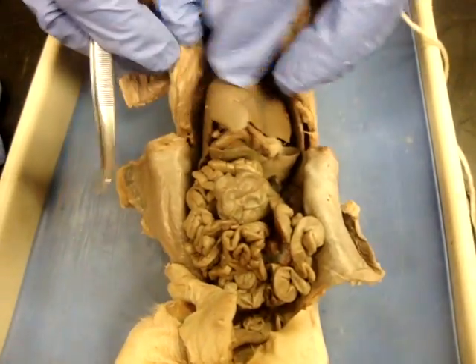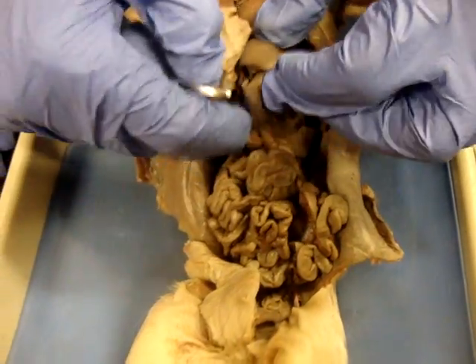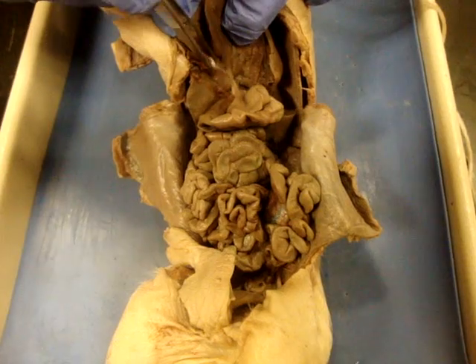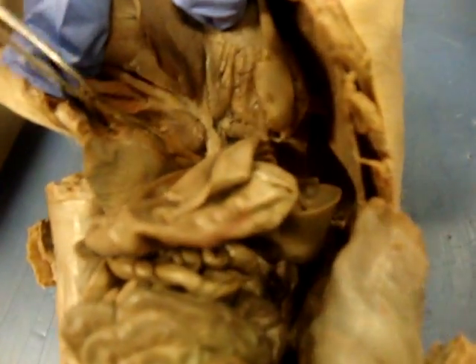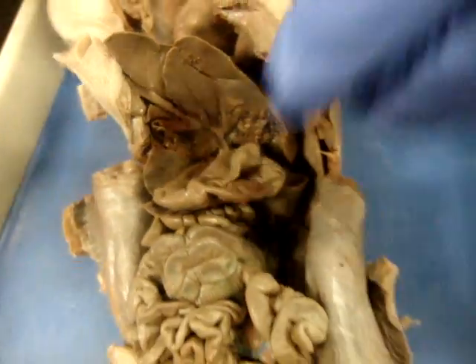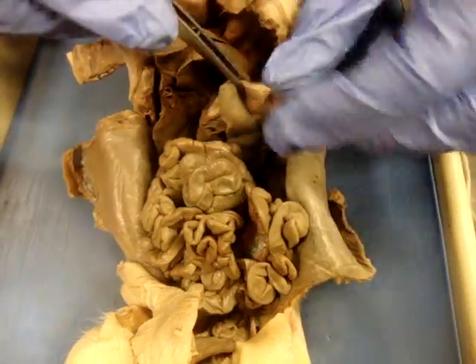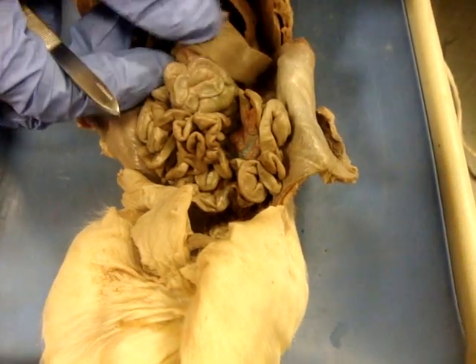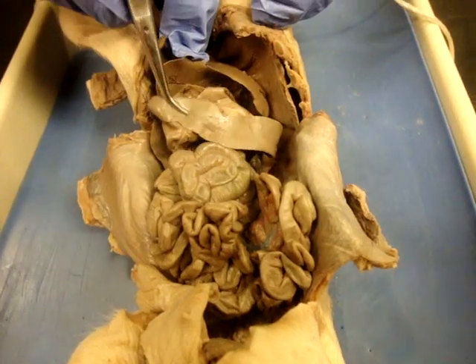Moving down the list, we then have the liver. The liver is going to be the first thing that you notice in the abdominal cavity. If you flip up the liver and look at the underside, you'll find your gallbladder. The gallbladder is a little beat up in here, but it's the bag-shaped structure you find underneath the liver. From there, we'll look at the spleen. The key for finding the spleen is to find your stomach — it's the bag-like structure — and the spleen kind of comes up and wraps around the stomach. It looks like a flatworm or a leech, just a really flat structure.